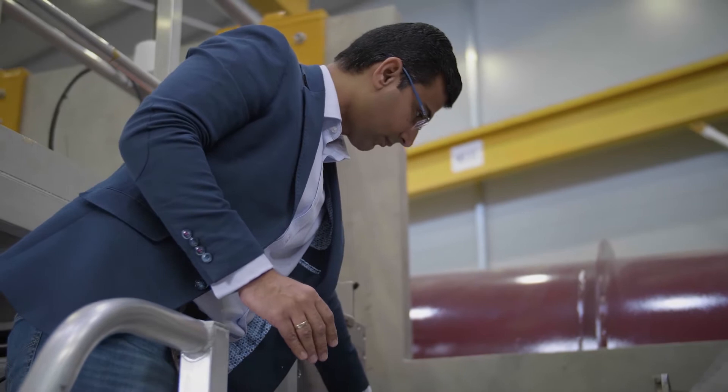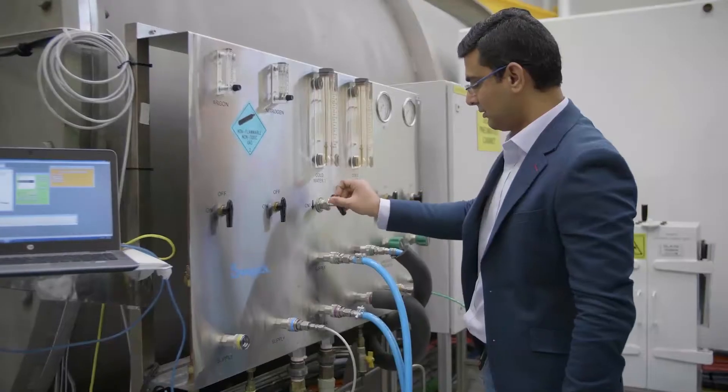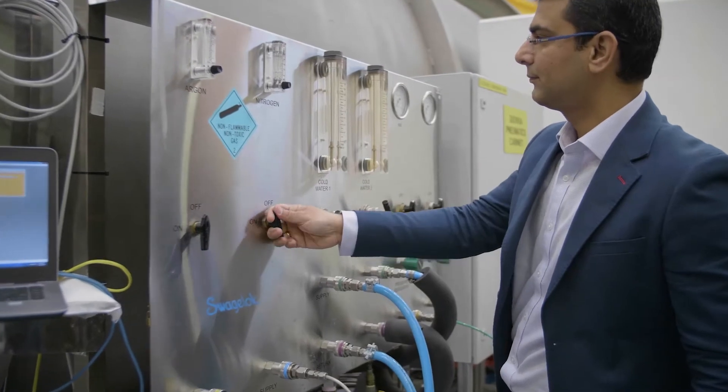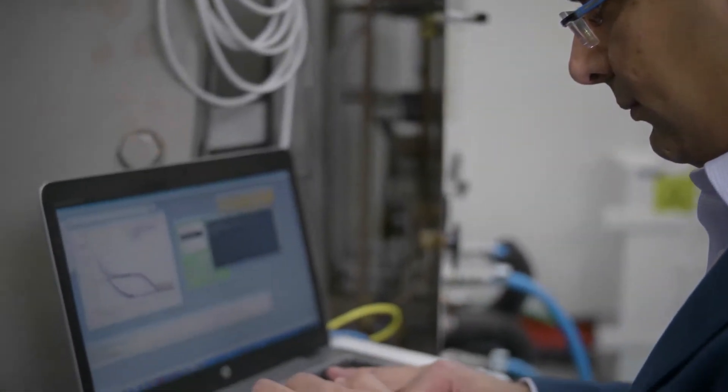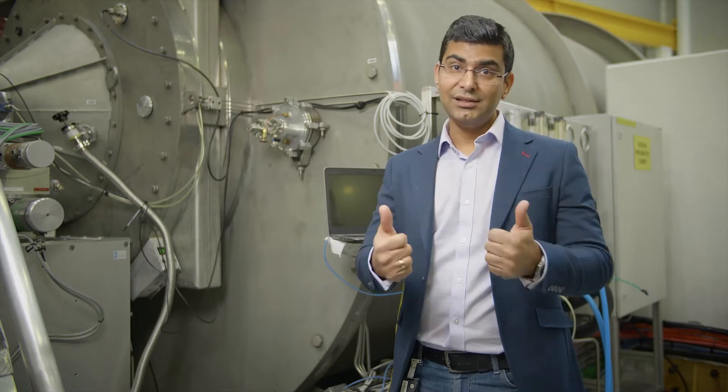Neutrons are very useful to study a very large number of systems. They have unique properties: they have no charge, they have very high penetration, they are non-destructive in nature, and they interact very differently with different isotopes. For example, if you want to study a system like artificial muscles in a very complex sample environment, you would use neutrons because light or X-rays would not penetrate through the sample environment, whereas neutrons could easily penetrate through, and you can study the system in its natural environment.